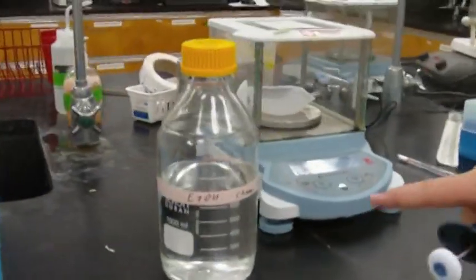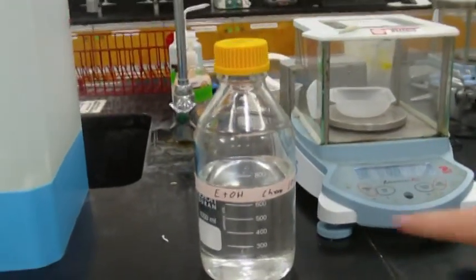All right, so let's go get our ethanol. What is this bottle here? This is ethanol, labeled ETOH. It's kind of a standard labeling for ethanol in chemistry. Okay, so now you're finding the density by? Doing exactly what we did with water, measuring the mass of 1 milliliter, 2 milliliters, 4 milliliters, and 10 milliliters. And then we're going to make that graph again, and the slope should be the density of ethanol, which we're not sure of right now, right? That is right. Okay, so we'll leave you to it.